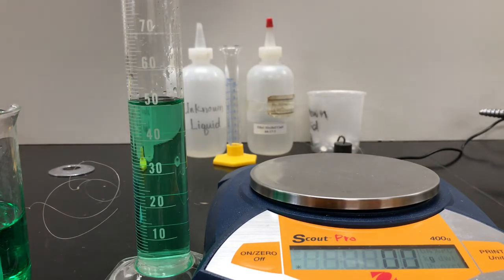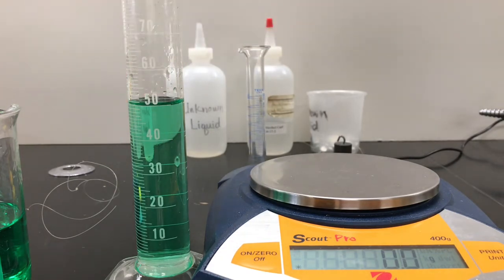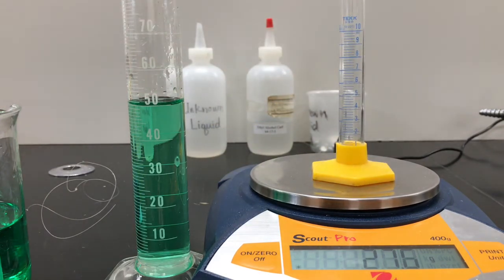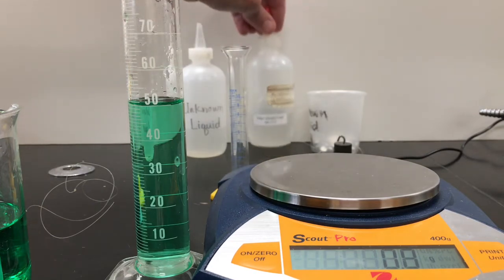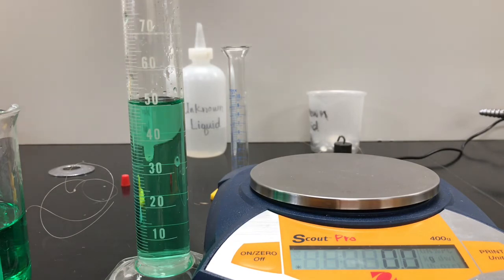All right. Now, the next scenario, we're going to take the density of a liquid, and we'll need a container to do that. And this is our container. This is a smaller graduated cylinder. It's only 10 milliliter maximum. Again, I'm going to re-zero my scale because I'm going to take the mass of this. Not that we want the mass of the scale in the end, but we want to know the starting mass of the scale. 27.6 grams. Because we're going to add alcohol, ethyl alcohol, in this bottle. And I'm going to add a set amount. Now we have to choose how much we want to add, what volume.